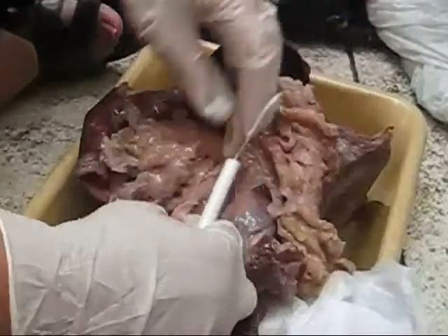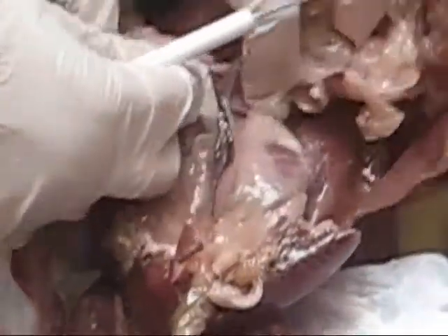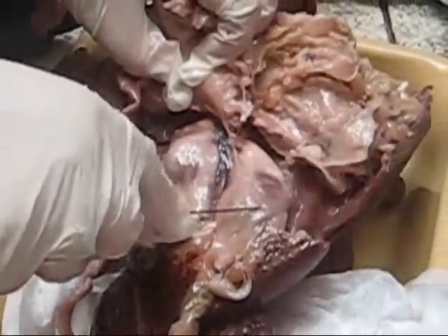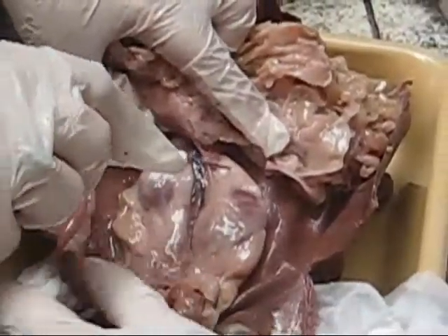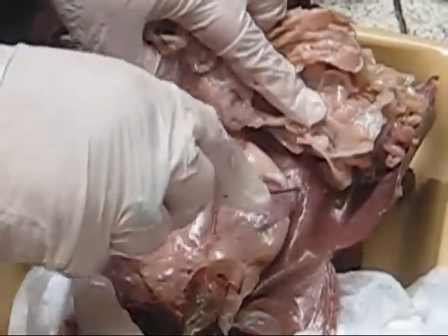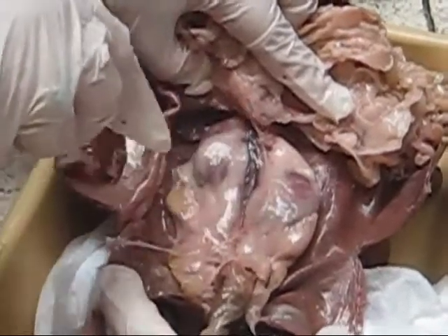This is a very nice fat one. We're looking at the kidneys now. Notice here you have two kidneys — kidney number one, kidney number two. Surrounding the kidneys you have the fat pads. Remember, you don't have bone protecting the kidneys, so you have fat pads protecting the kidney.